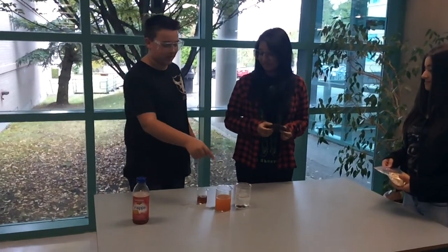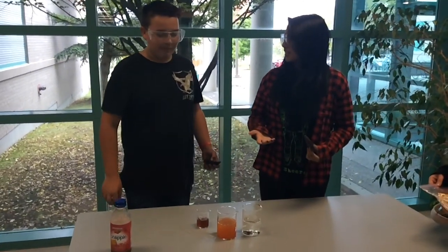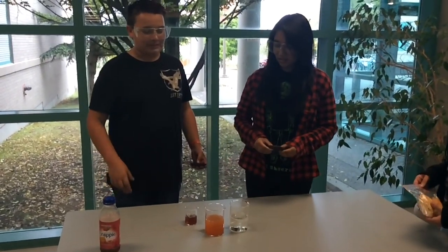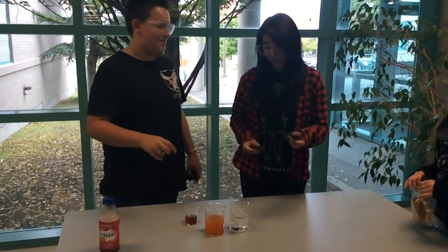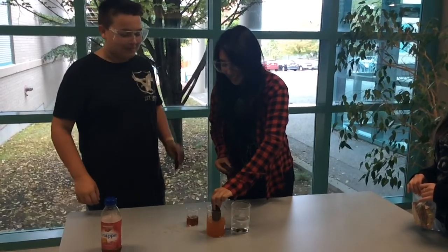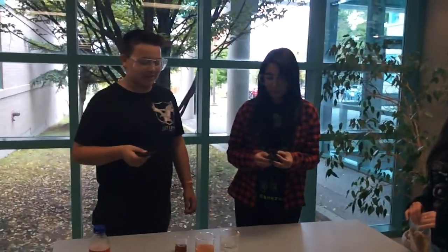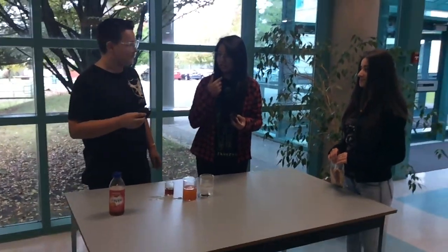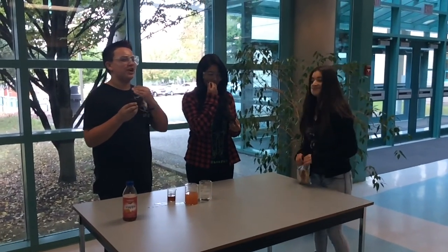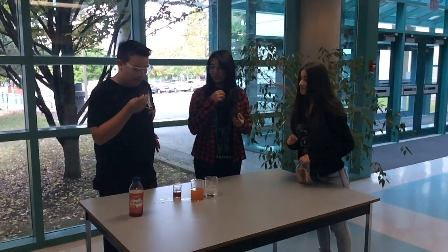You should dip it in the pineapple juice. Are you sure it's pineapple juice? Are you sure it's not? Like, I thought we just mixed something. No, it's pineapple juice. Just dip it in there. Yeah. How does it taste? Good. Mmm. My tongue is burning. My throat hurts. Ow. I feel like there's a giant hole in my esophagus. Oh, maybe that was acid.